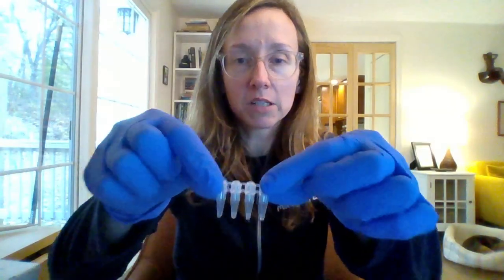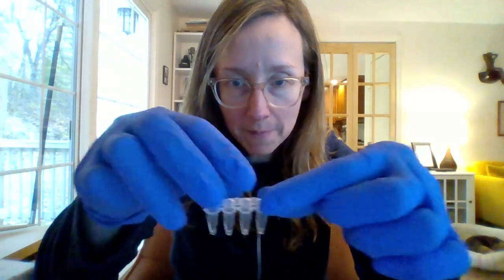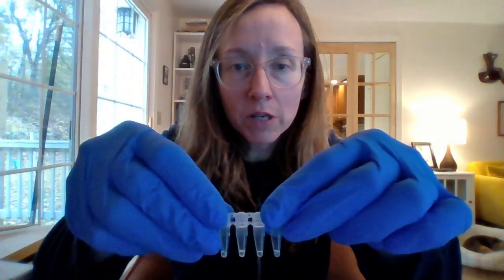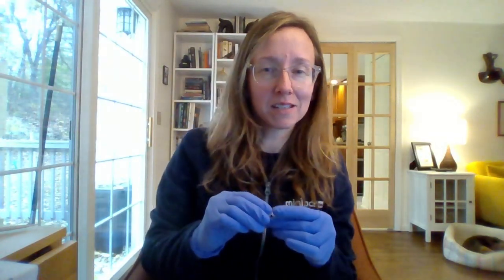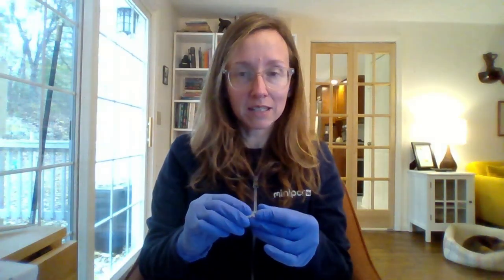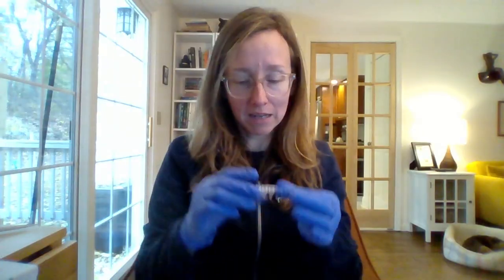And I'm going to take 2 quick observations before we start our incubation. First, I'm just going to visually check my tubes and see that the volumes are pretty much similar across all my 4 tubes. They look pretty consistent to me. If you had a student group and you saw that their tubes had really varying volumes, that would be some indication that maybe they missed a step, maybe they pipetted incorrectly. If I had extra reagents, I would give them a new set and have them try again. Mine look pretty good though, so we're going to proceed to observation.